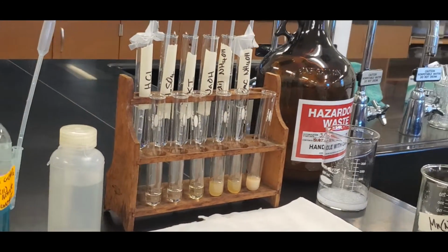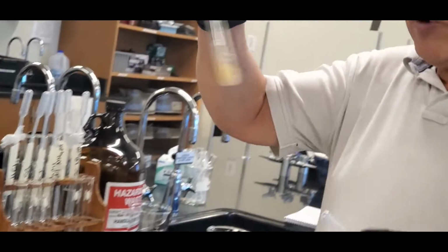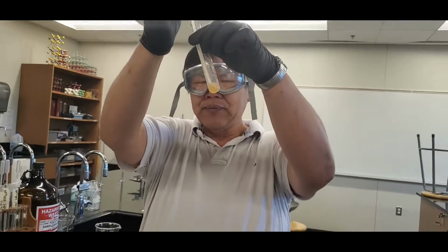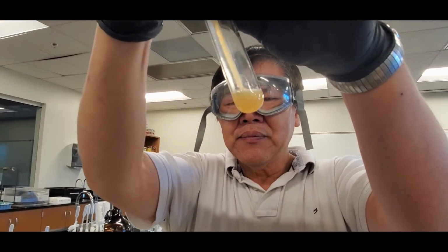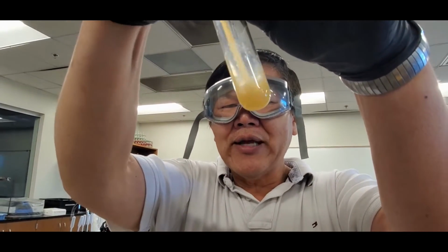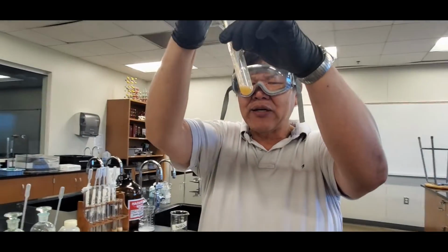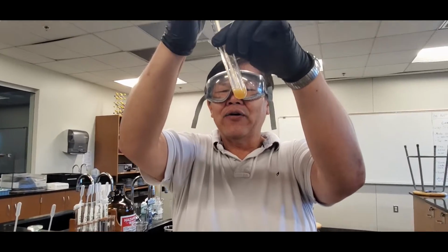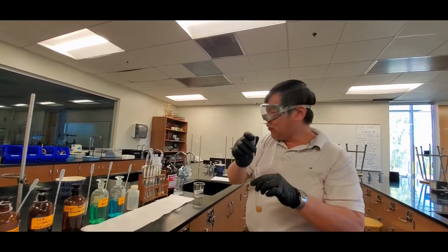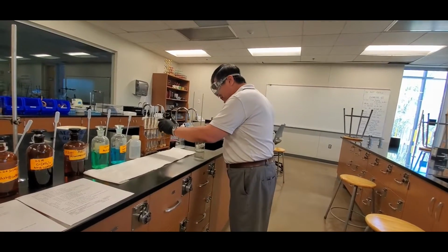Now, something I want you guys to see is this. This is the characteristic of manganese in the sense that, watch this. I'm going to pump air into it. And pretty soon it'll darken. It's forming that manganese hydroxyoxide. So if I do that enough, you see originally it was really light, and now it is getting darker. Pretty soon you'll see coffee grind stuff on it. So that's one of the characteristics of the manganese hydroxide. I'm going to stop, and then I'll take a picture for you so that you guys can look at it later.